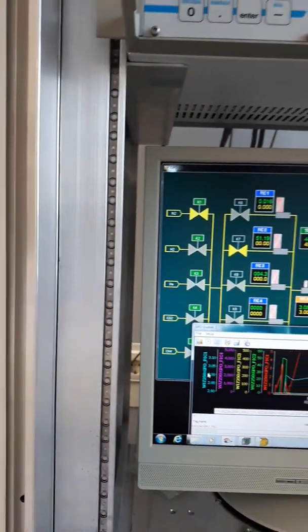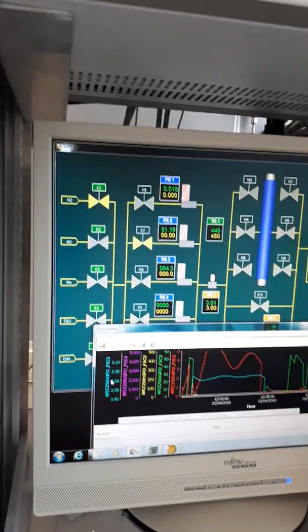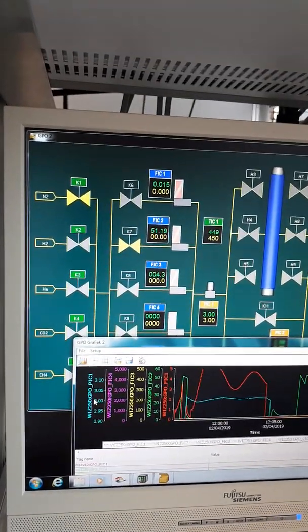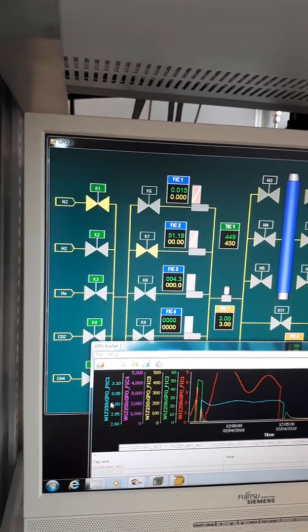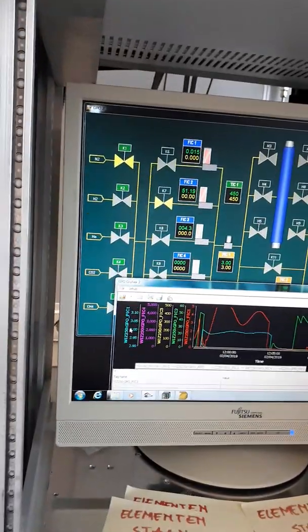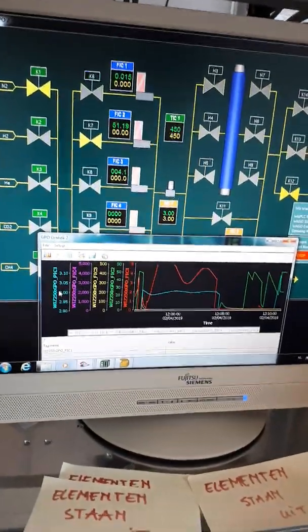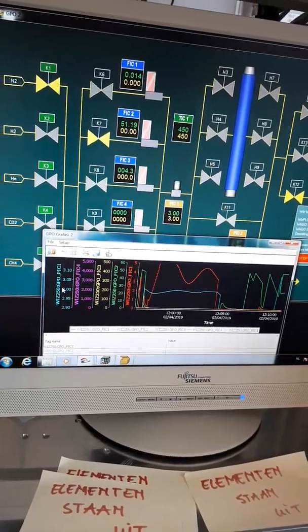So how is it going until now? We are doing the small one, that's one bar or what? Three. Wow, you're courageous. You really want to test the system, huh? Yeah. You're at 10 bar now. Three. Oh, 3, okay. But you have the impression that the alumina layer is coming off, or is it palladium? Alumina is coming off. It started in the middle in a spot where you can see something. That was my doubt. But later on, you see on the rest of the layer that the alumina layer is peeling off with it because of forces, etc.